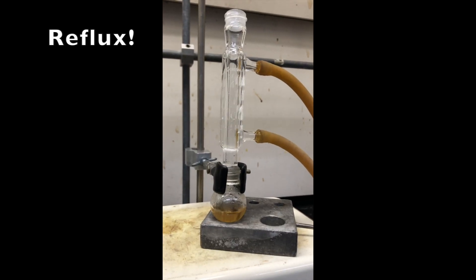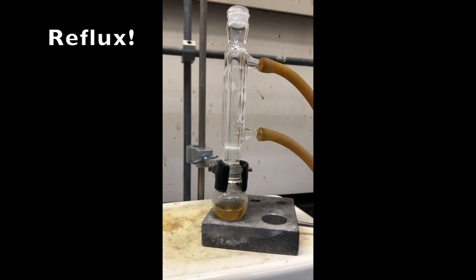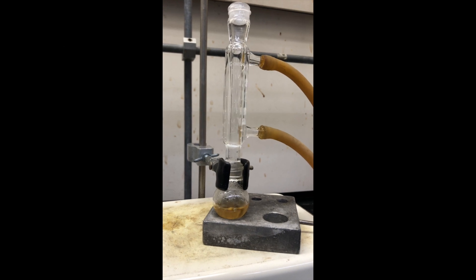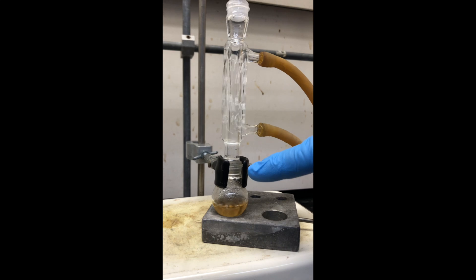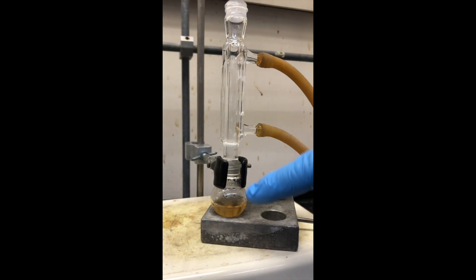Now our reflux apparatus is finally at reflux conditions where we see that the bubbles are coming off vigorously and we have condensation going up into the condenser and then dripping back down.